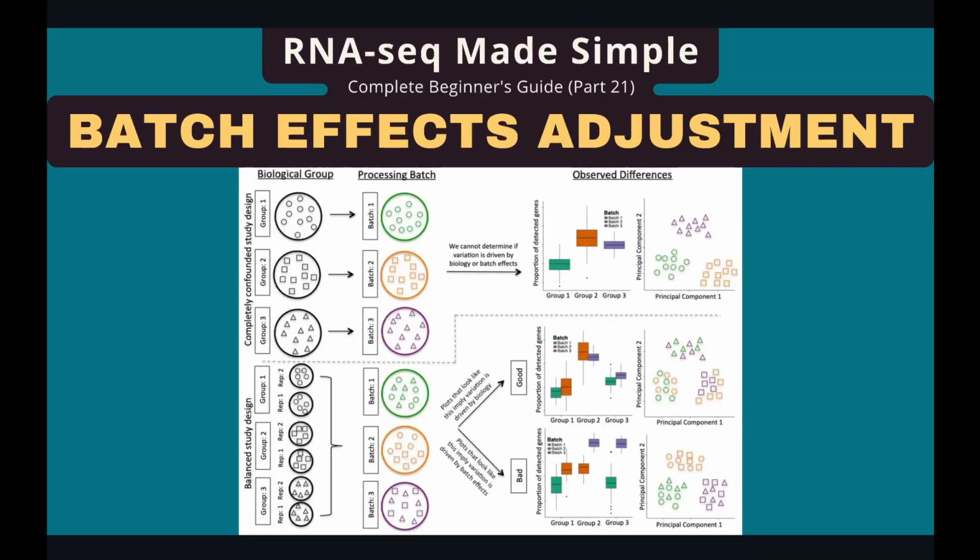Of course, the best study design is to process all the samples at the same time by the same person on the same day and sequence them on the same plate. In this way, there will be no batch effects at all. However, in reality, the most commonly used study design is the balanced study design. In this design, samples are mixed and then are sequenced in different batches. In the PCA plot, samples are most likely clustered by batches, and ideally we'll be able to remove the batch effects and only preserve the differences between the biological conditions. And this is the topic for today's tutorial.